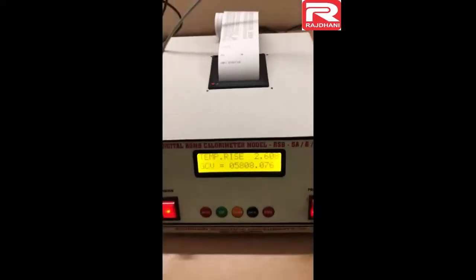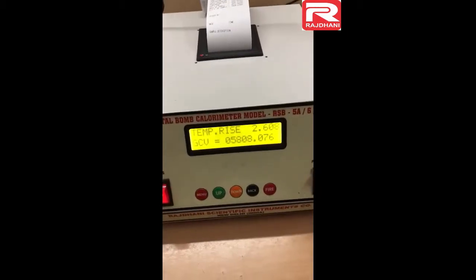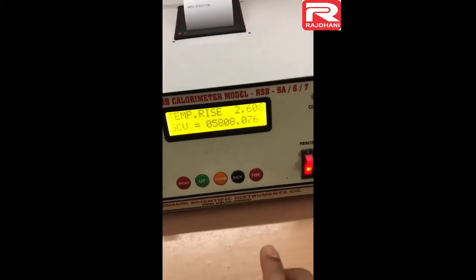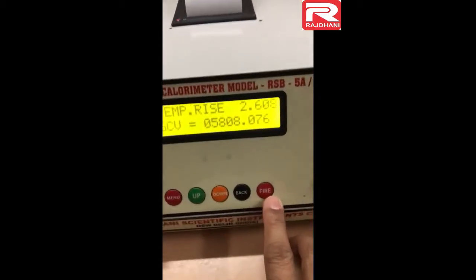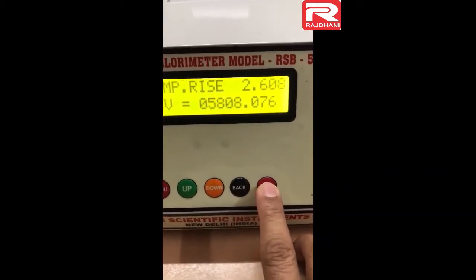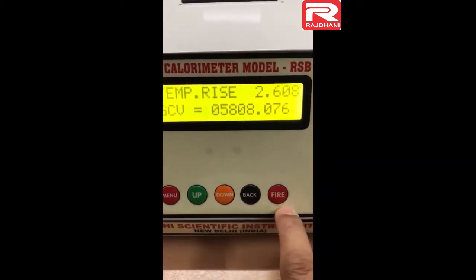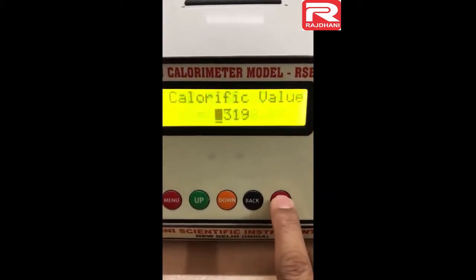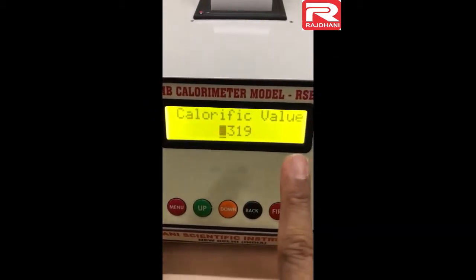For the benzoic acid case, our main objective is to find out the water equivalent. To find the water equivalent, we have to press the fire button again. When I press the fire button again at this point, it is asking for the calorific value.